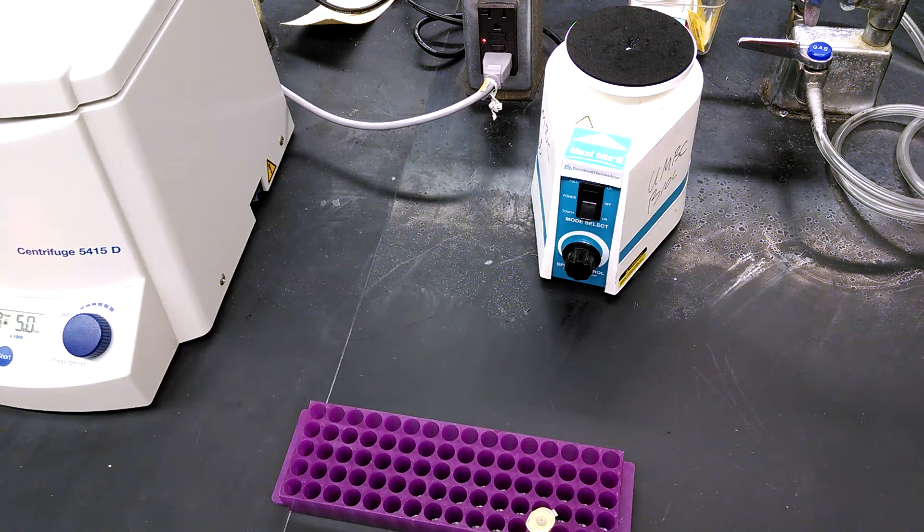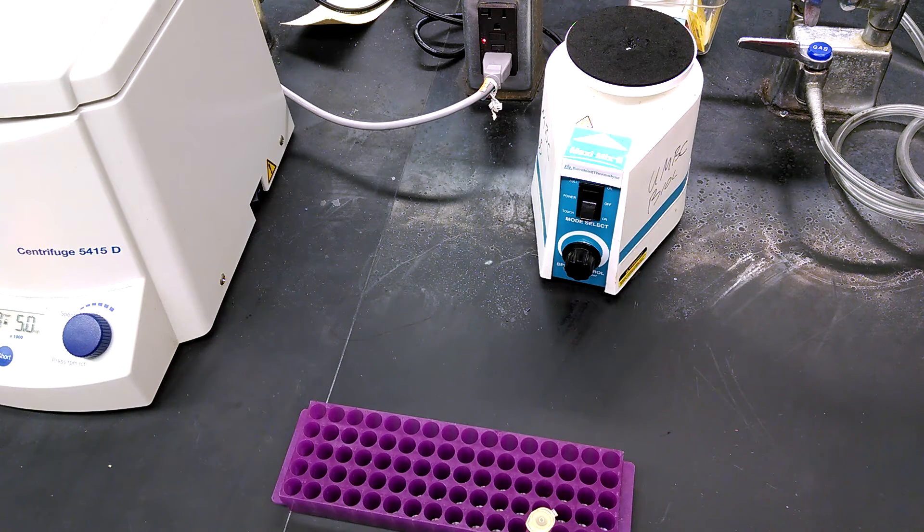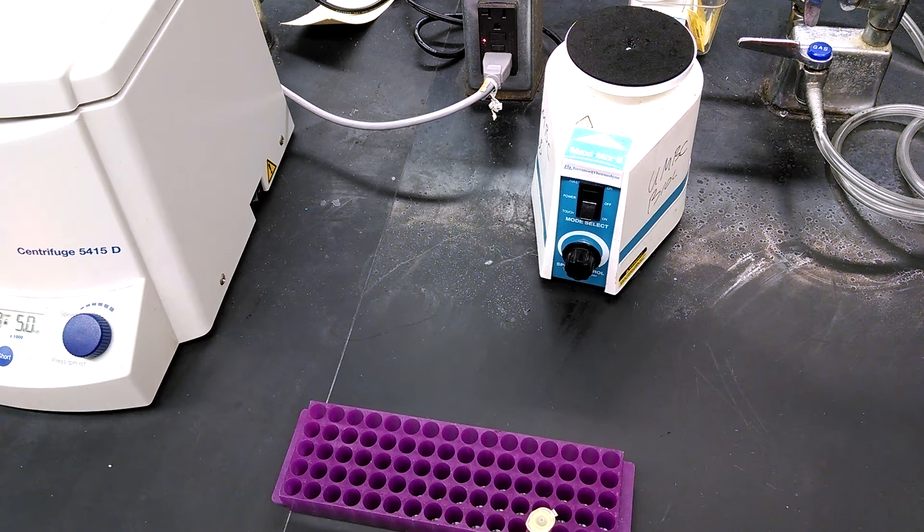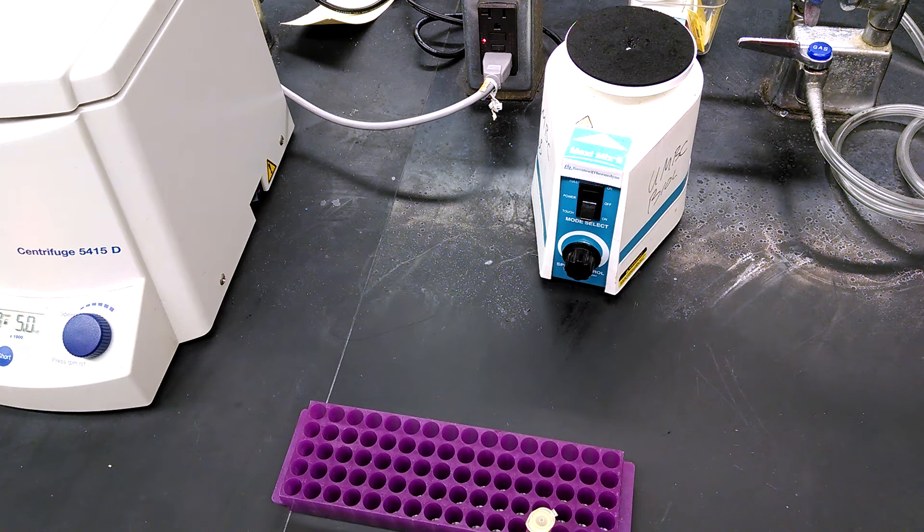This is a genetics lab video demonstrating the PCR procedure for the cheek cell test that you'll perform in the human variation lab.